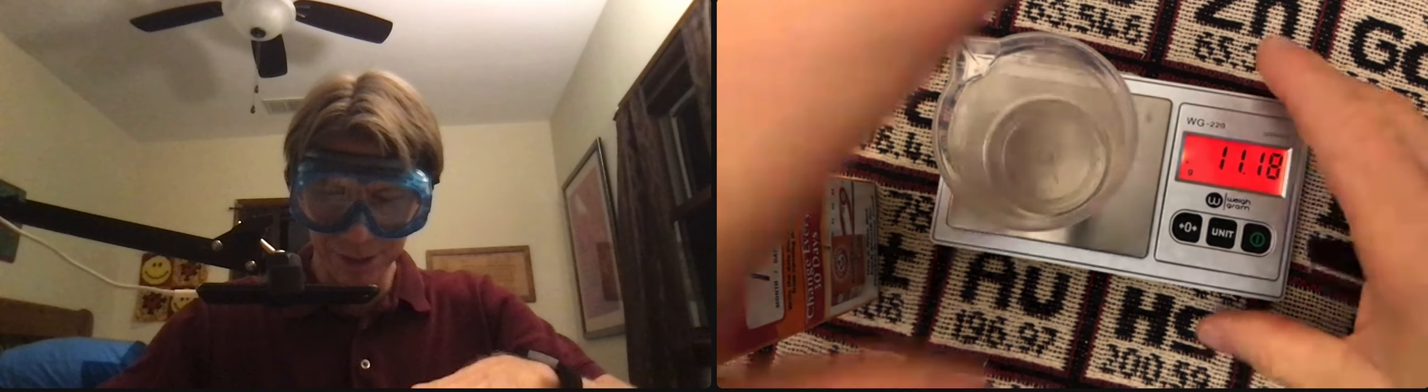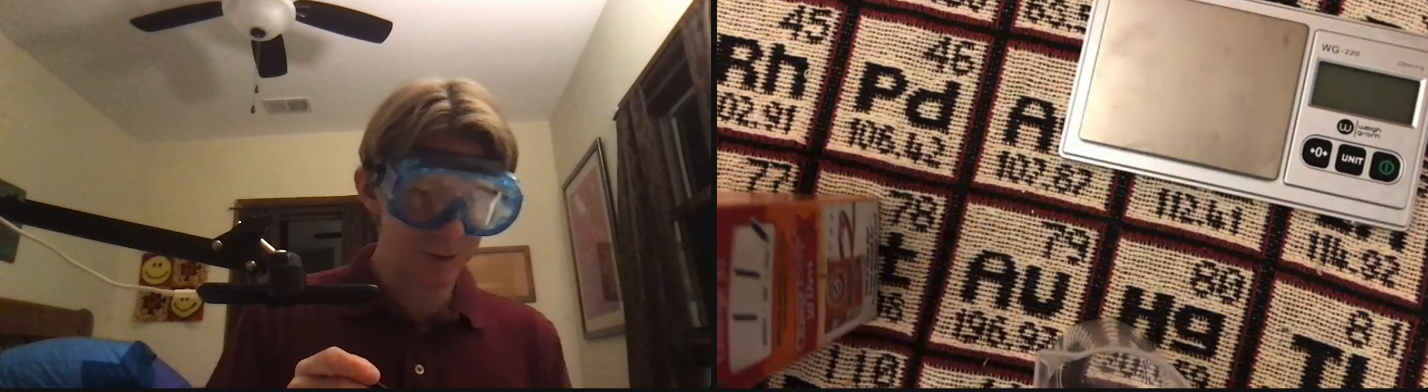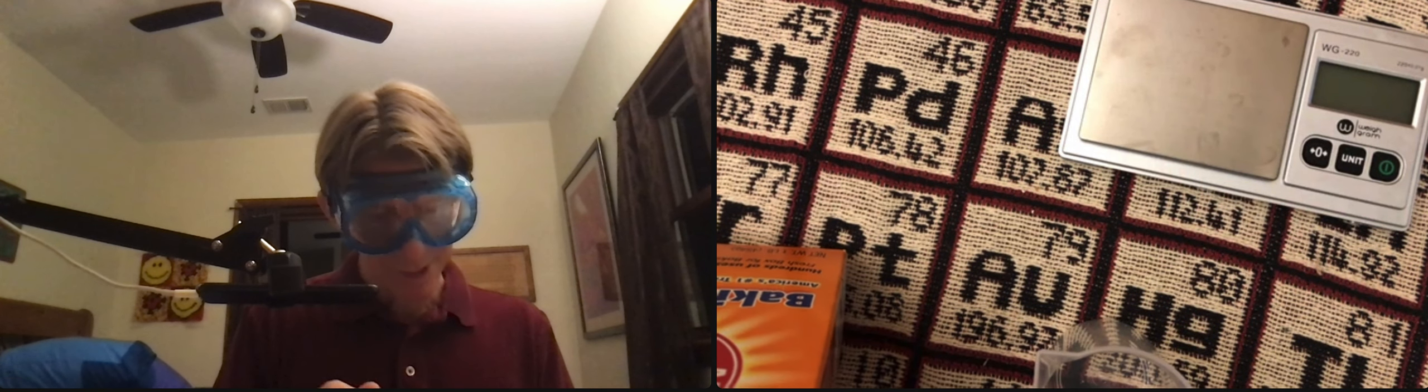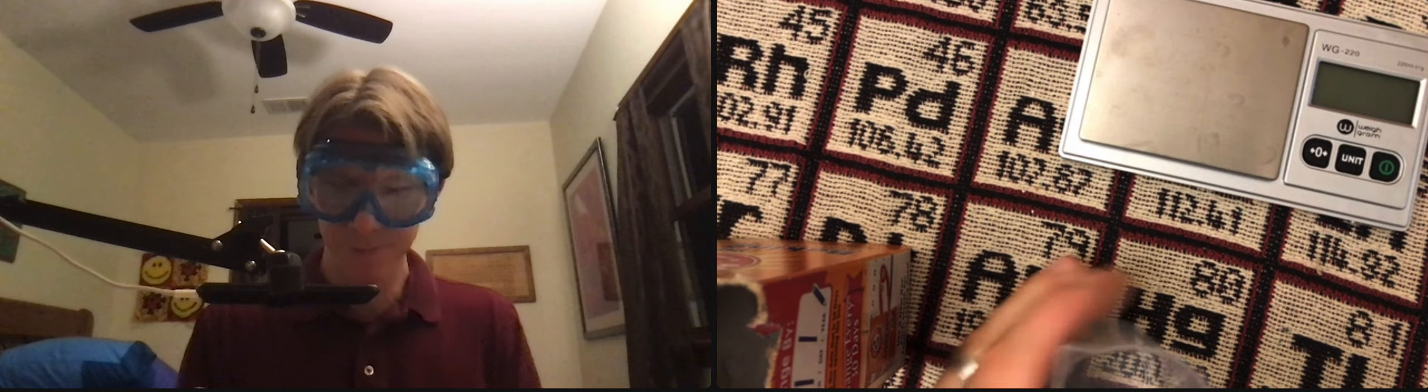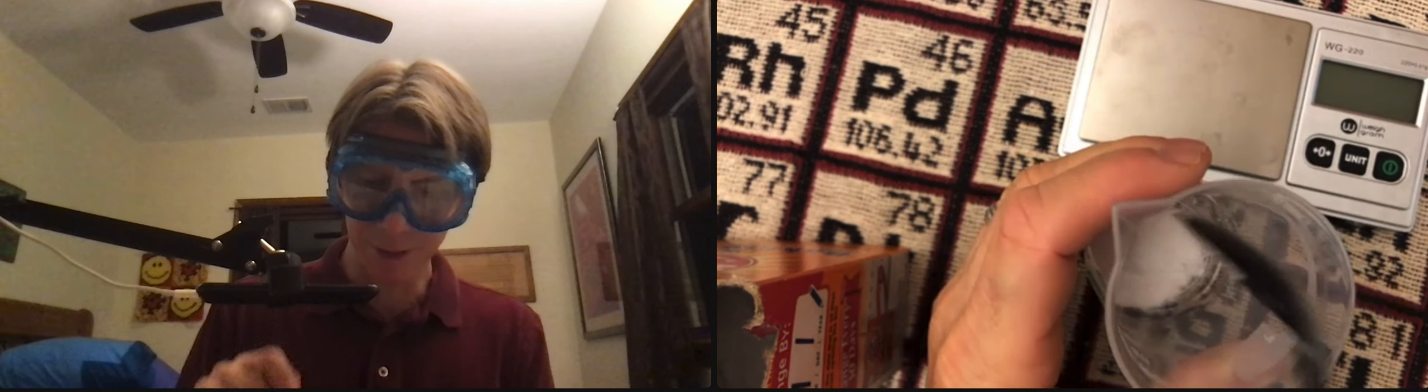And this is a good idea. I'm going to take this off. I think that's about as much as I need, just a little bit. See how we do.